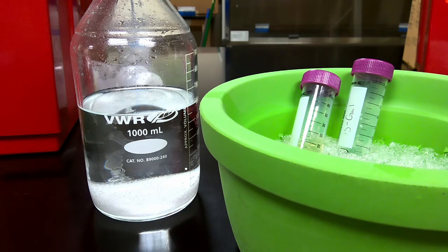It wasn't viscous anymore. And the last thing I added was not magnesium chloride, but streptomycin sulfate. Streptomycin sulfate is a salt. I added about 666 milligrams to my lysed cells. The reason is that streptomycin sulfate will precipitate out the DNA, so the DNA will come out of solution.